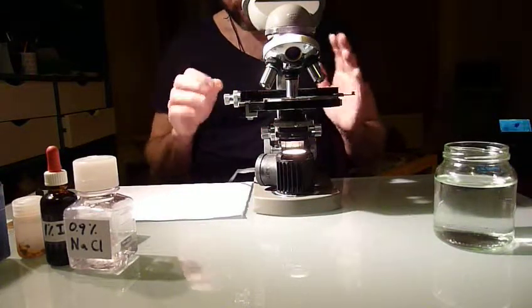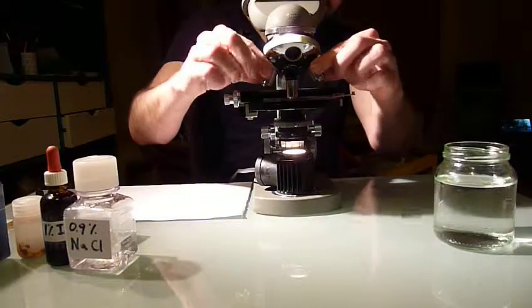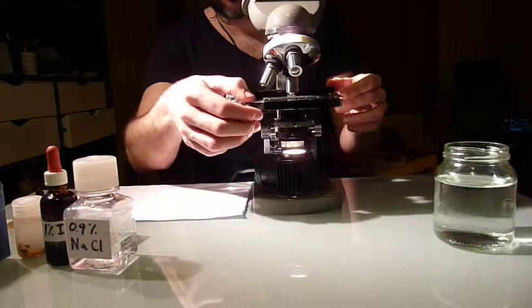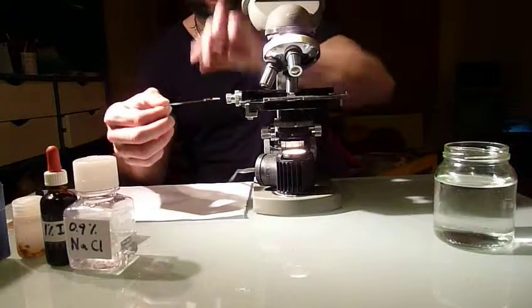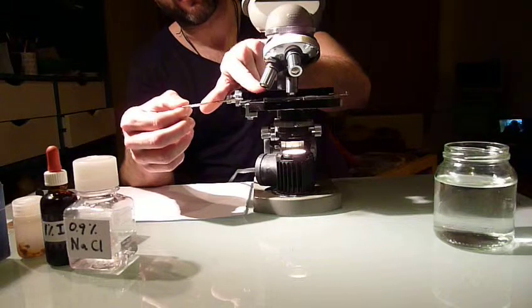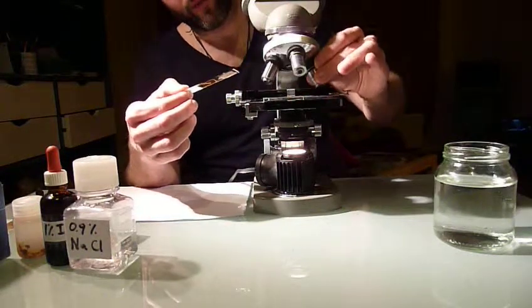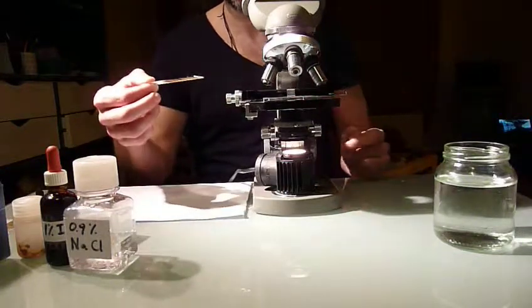So when you've looked and you've determined whether there are cysts present or not, then you turn again to the 10 times lens, just because if you take off the glass and you lift it a bit, it may touch the 40 times lens. They are very close together, and either you may damage the lens, or you may rub some iodine on the lens, which will damage it. So first either move it to the 10 times or to the spot where there is no lens, and that makes it easier to take out the sample.